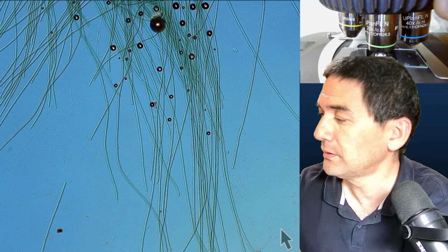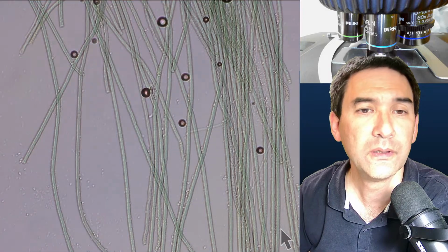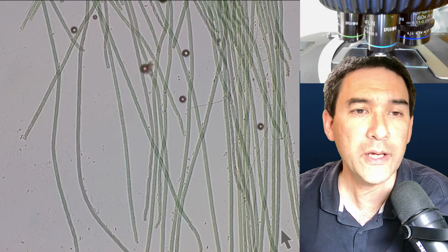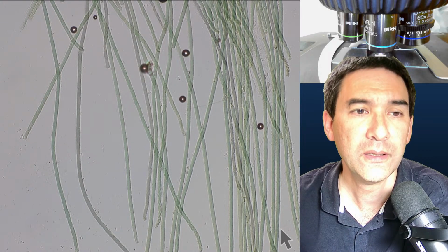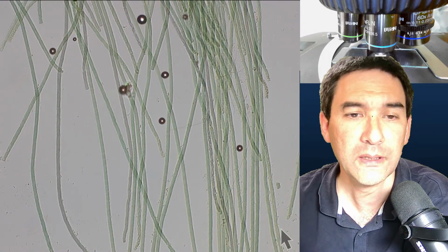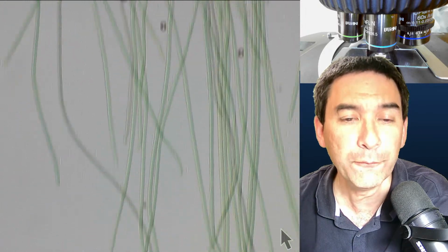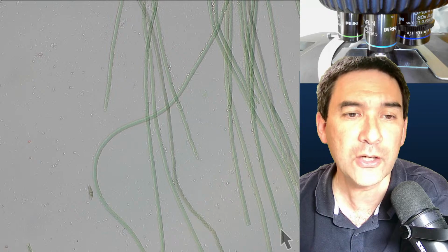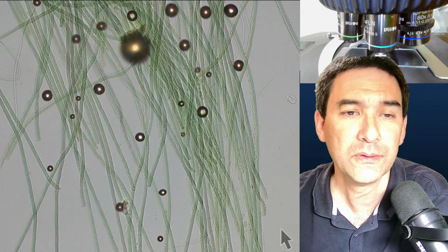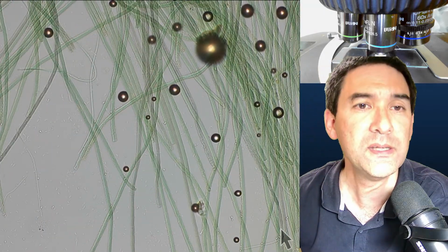Be careful with this. But then again, of course, when objects dry up, then they will lose their natural shape, and you might be introducing some artifacts, and it still looks different than if you were to take a fresh sample. Okay, but still, I think you do get the idea a little bit that this seems to be working as well.